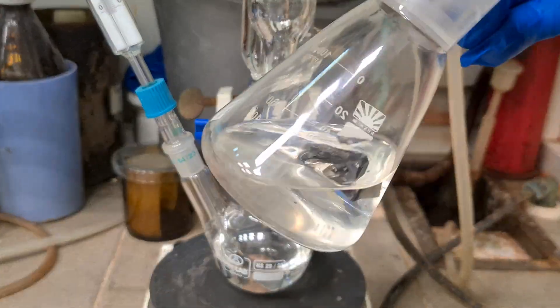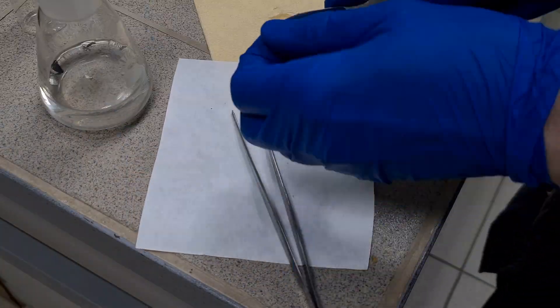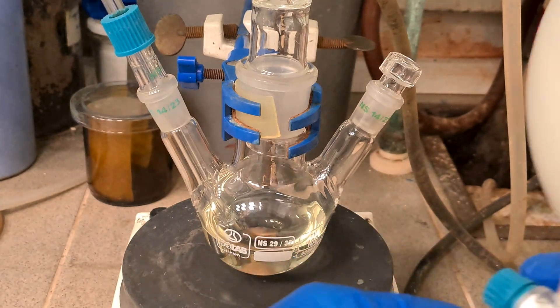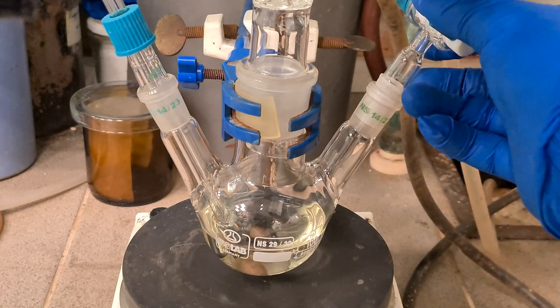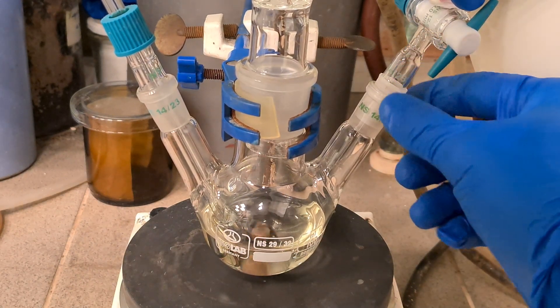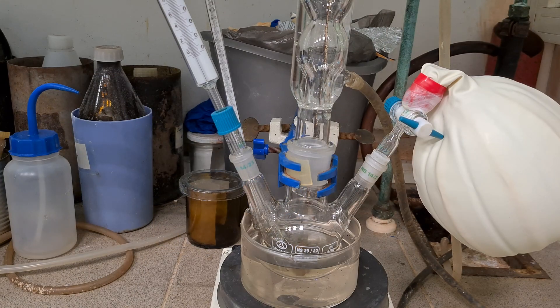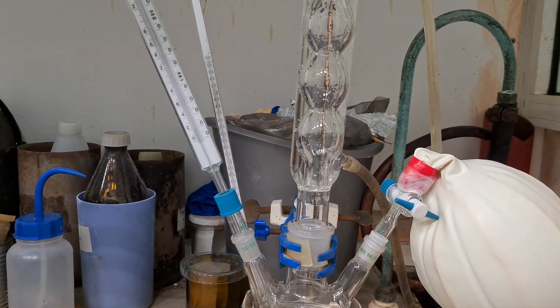Now slice into small pieces 1.7 g of lithium metal and put them into hexane to prevent oxidation and remove oil from the storage of the initial material. Further, we need to flush the reaction vessel with argon pretty well. Also, you may have noticed the yellowish color of the solution — it's associated with tert-butanol and THF short-range assembly formation.